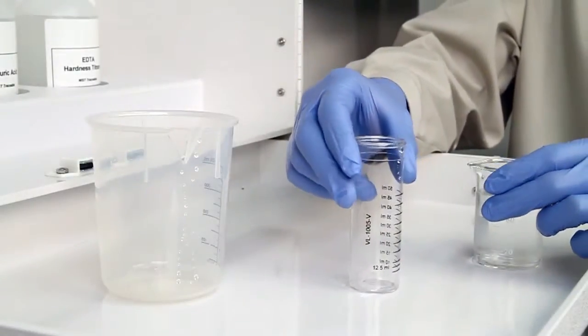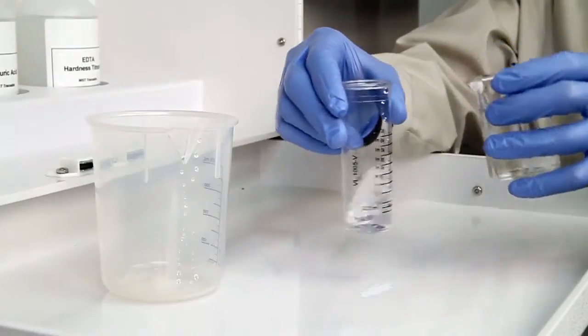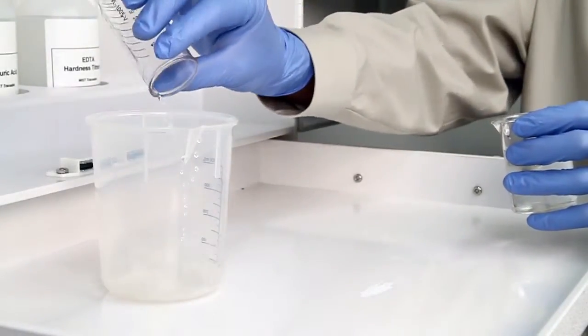The first step according to the Endpoint ID procedure is to collect an accurate sample. The smallest change in sample size will lead to inaccurate results.